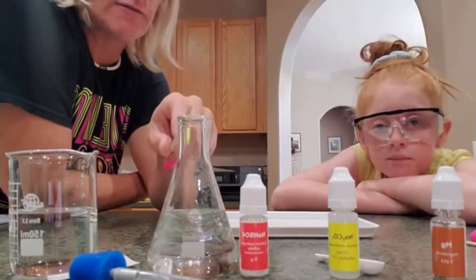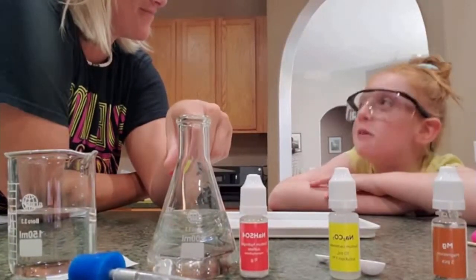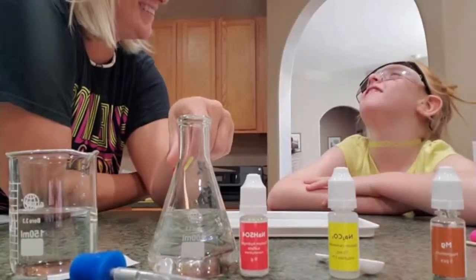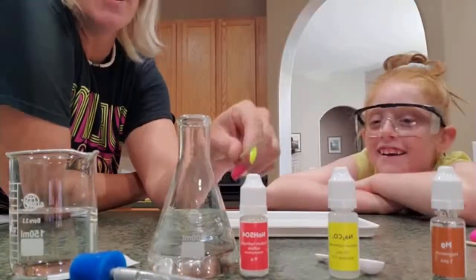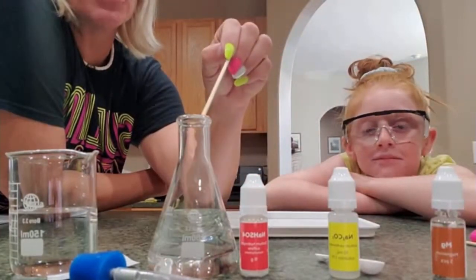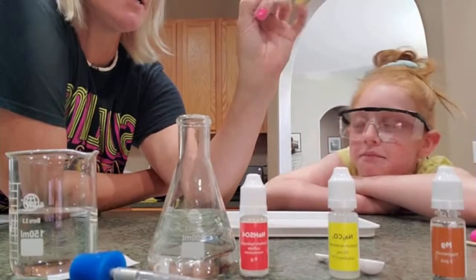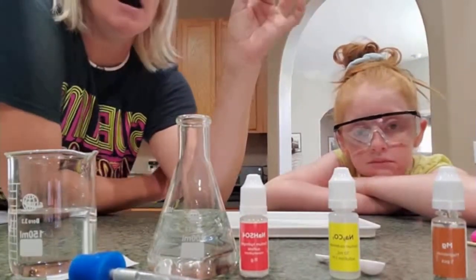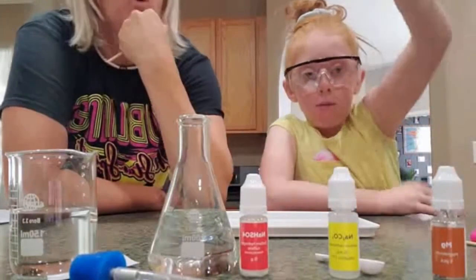We have our flask here and it has 100 milliliters of water in it. And then we also have a couple of things that we're going to be adding to our flask here, including some sodium carbonate and some magnesium.